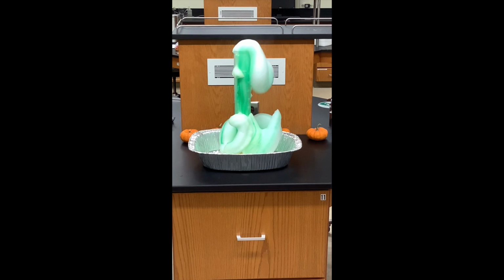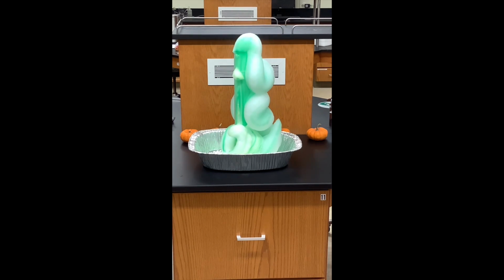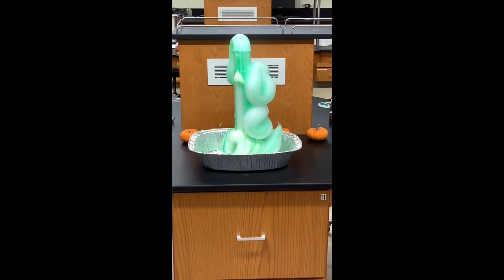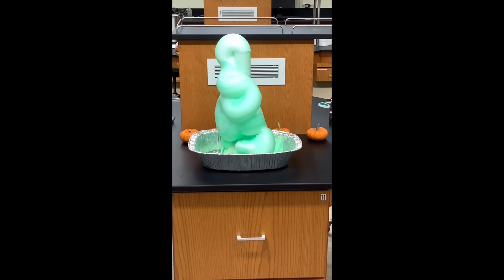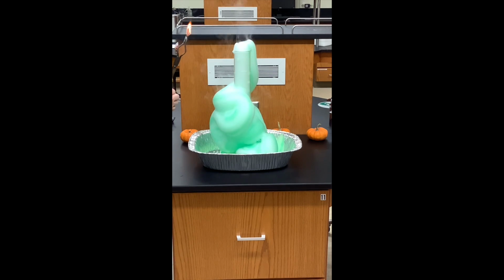So we call this elephant toothpaste because we use a large tube so that we can squeeze out all of these nice bubbles. And we can test this again with our flame test to verify that it's oxygen gas. If it relights the splint, that means that it is oxygen gas. And you can see the steam a lot better in this reaction because it's exothermic. So there's the flame test.